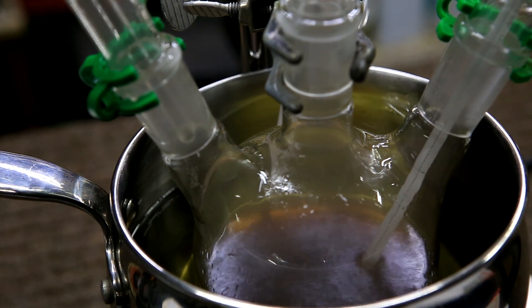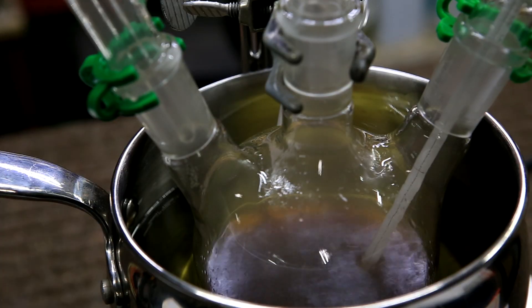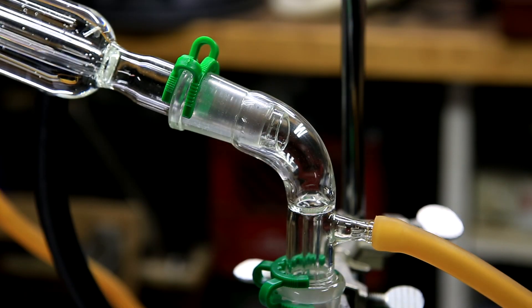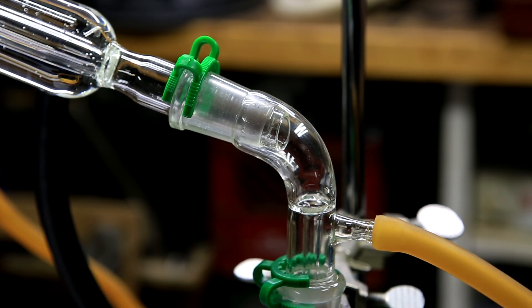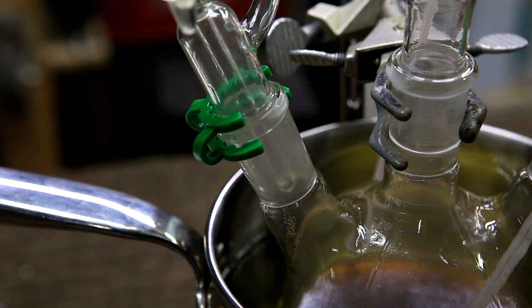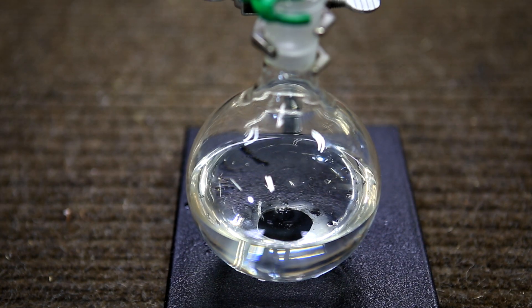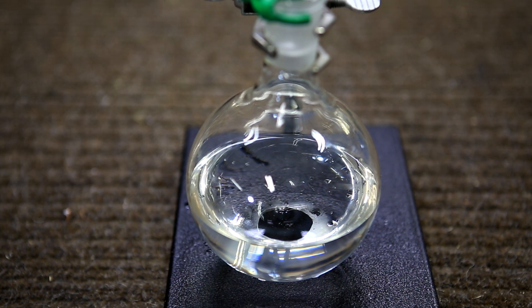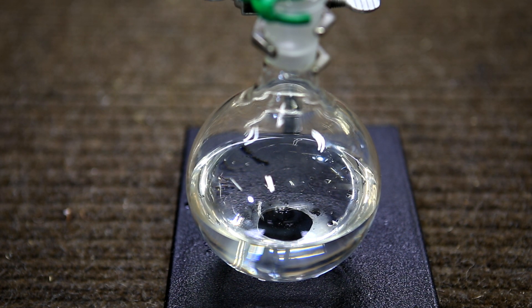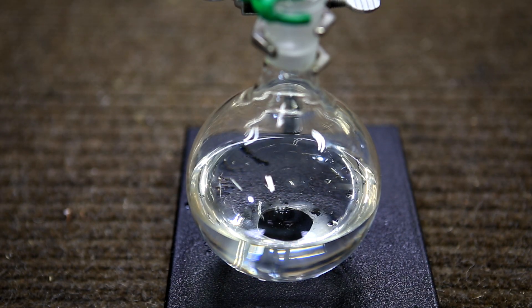However, at 130°C, the rate of production is very slow, so you want to increase the temperature until at least 140°C. You want to match the rate of ethanol addition from the addition funnel to the rate of ether that is distilling over. This is my final crude yield of diethyl ether. Because I used the fractional column, the amount of ethanol, water, and sulfuric acid in my final product will be less than if you use simple distillation.